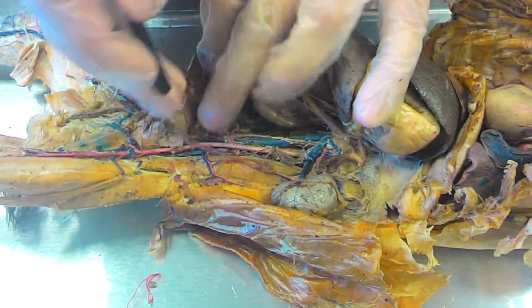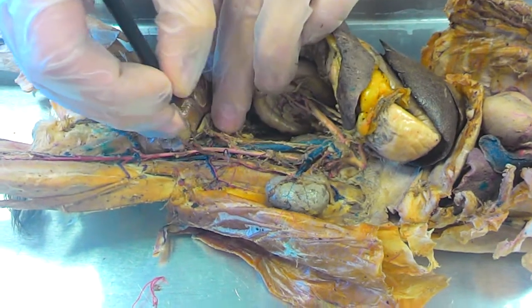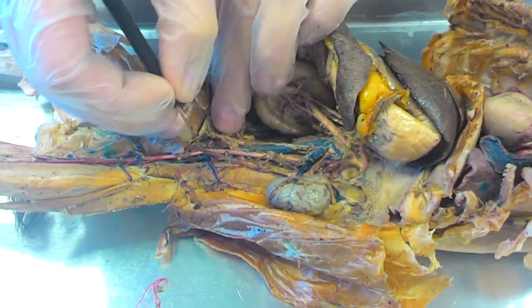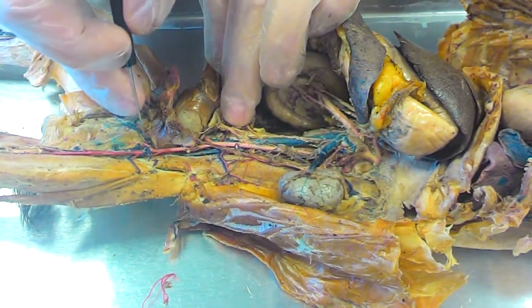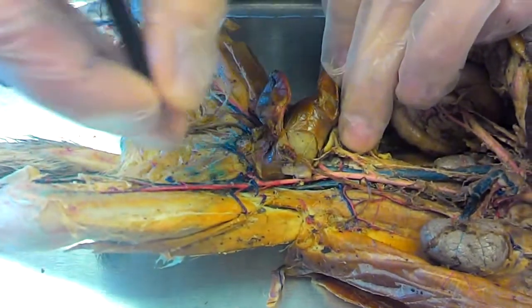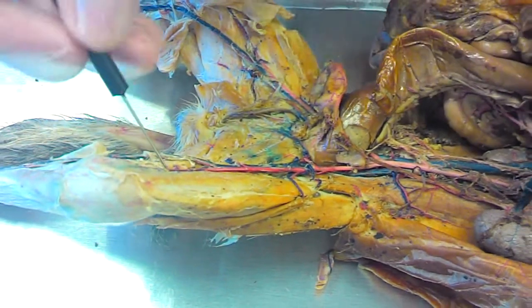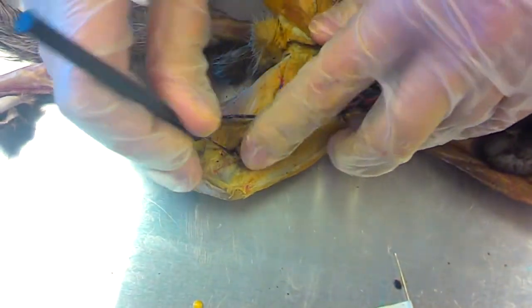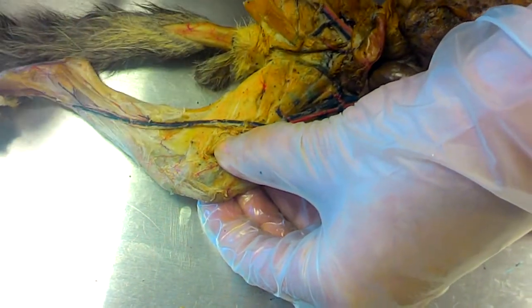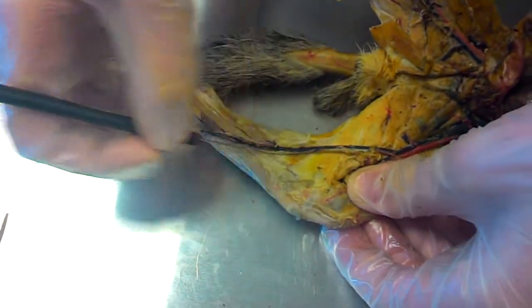Then when you get to the V down here, you have on the vein common iliac vein, external iliac vein. Then after the deep femoral vein, it turns into femoral, gets to the knee, goes to the back of the knee, and is popliteal. Goes down the lower part of the leg, and it's the great saphenous.